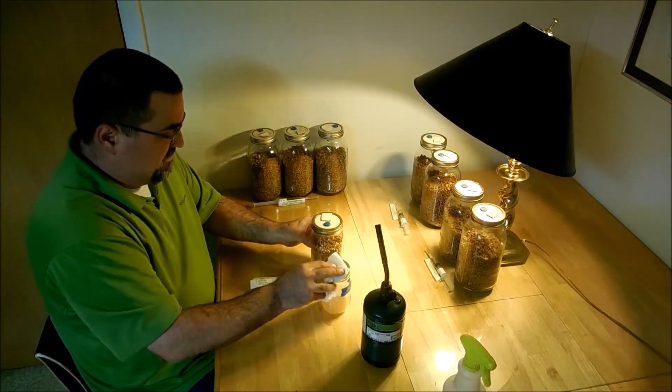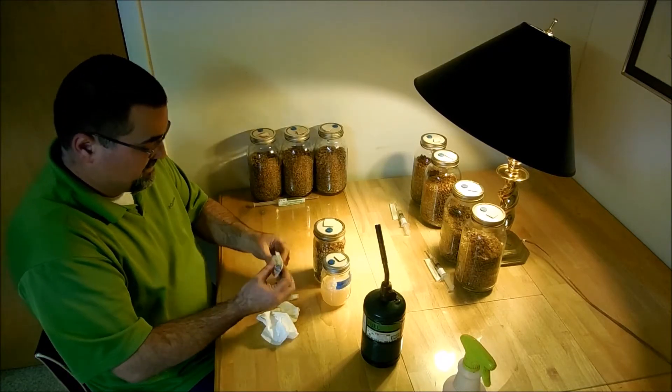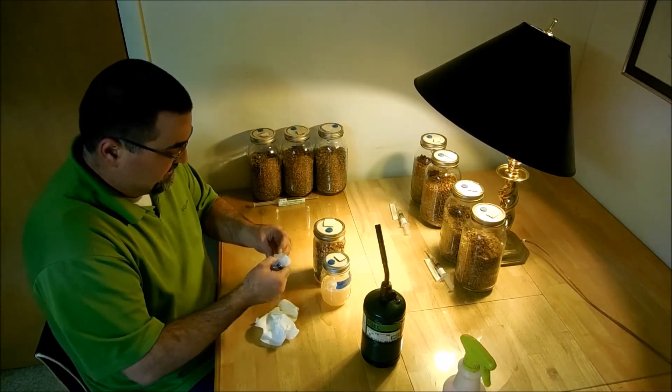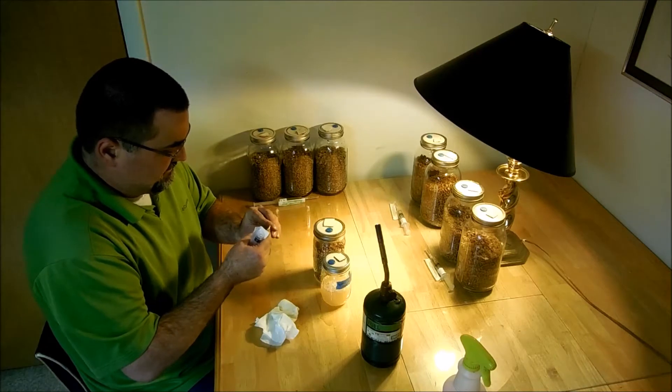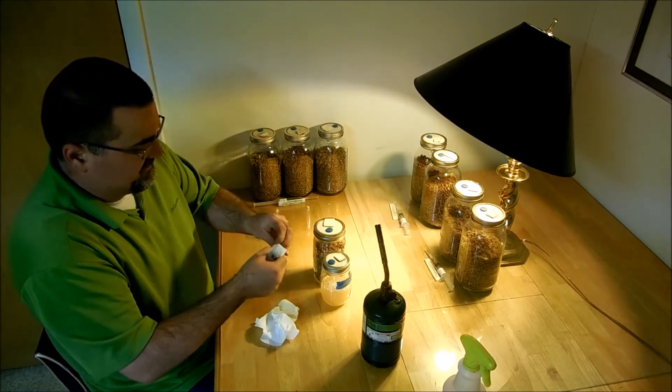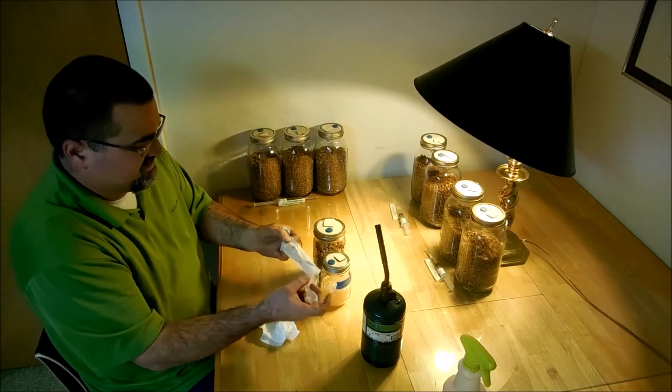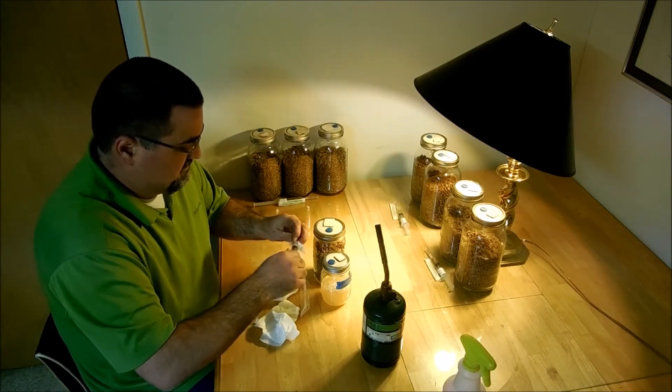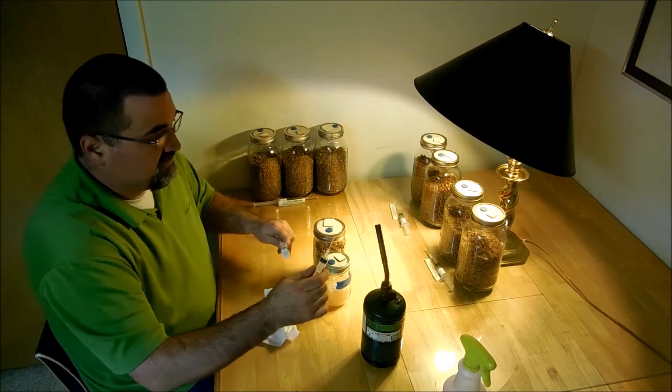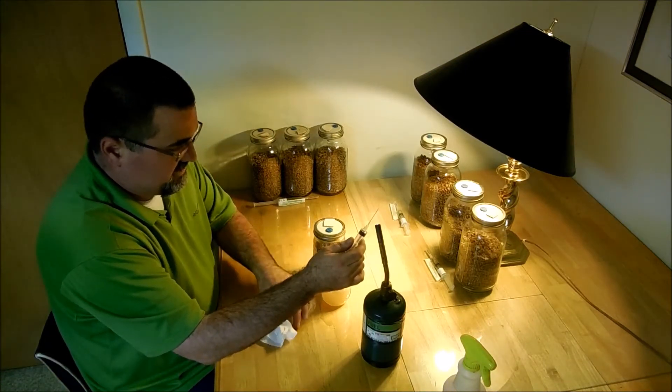Make sure these guys are sanitized. So I'm going to use a fresh needle. I see no reason to flame sterilize this for the first injection here, but I'm going to anyway because that's what they tell me to do.